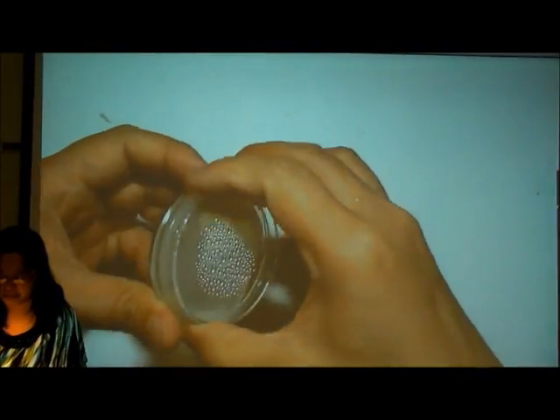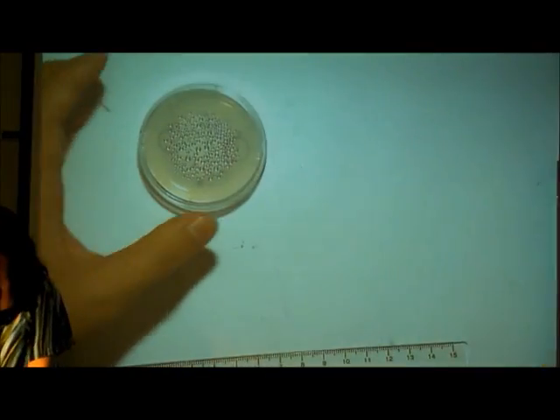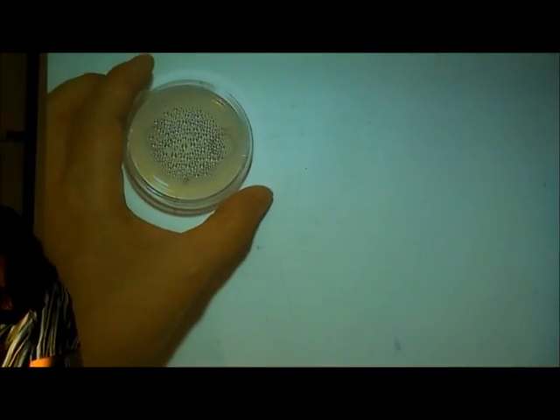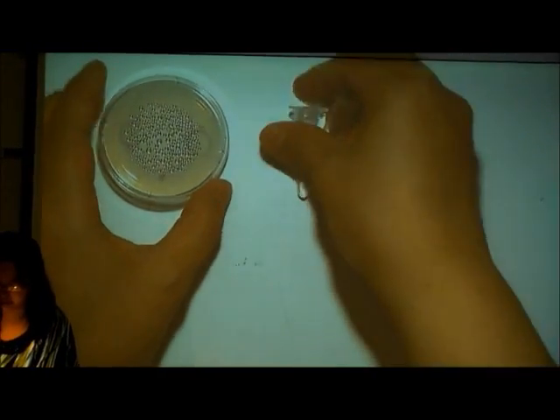Then turn the plate around. I want to put the chemicals on my spots.